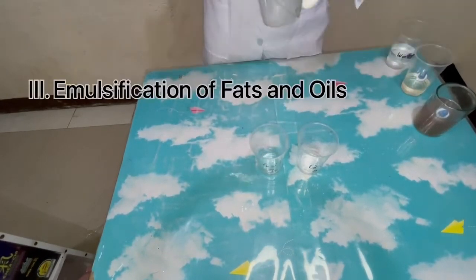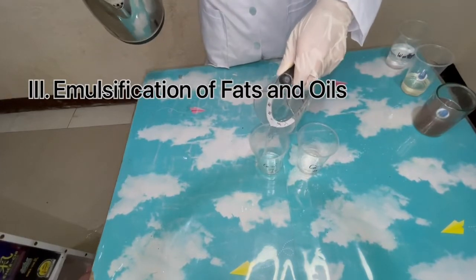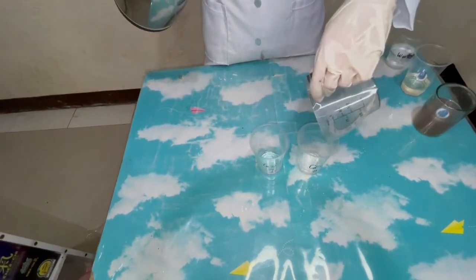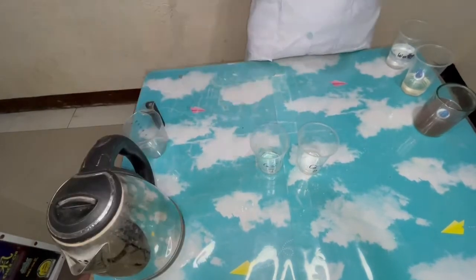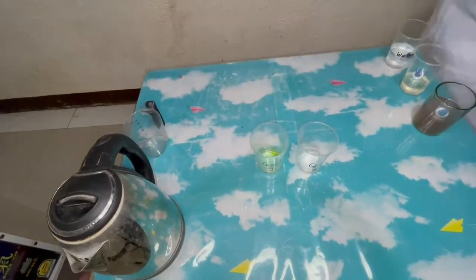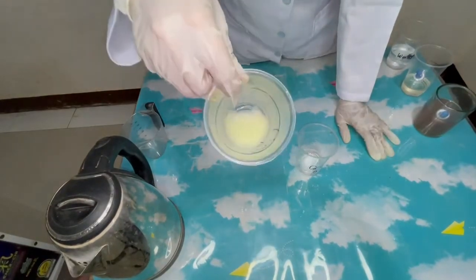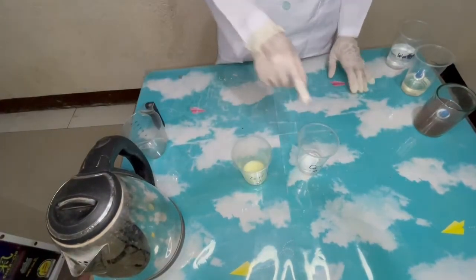In Part 3, the emulsification of fats and oils: the coconut oil with hot water is still insoluble, while the coconut oil with hot water and soap solution is now soluble with each other. Here's the result.